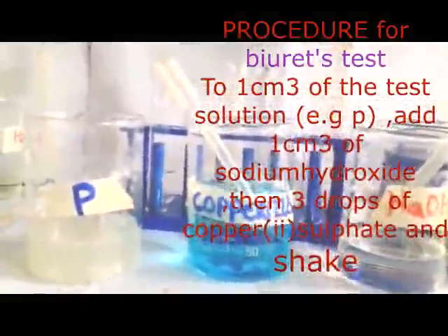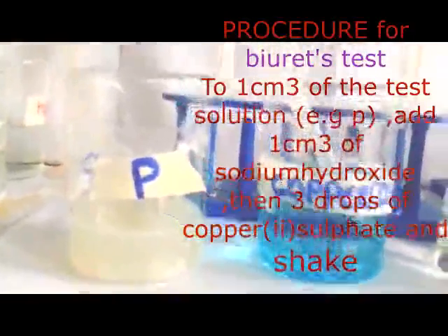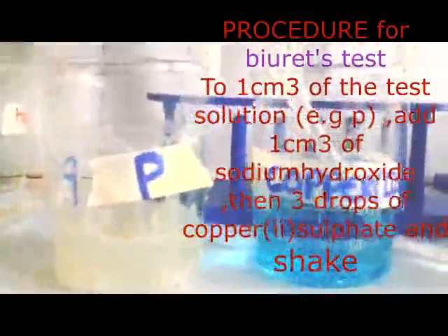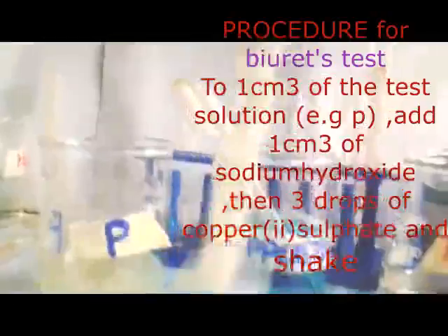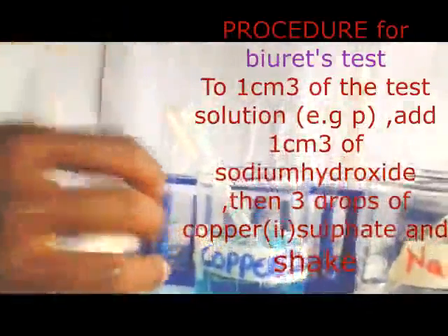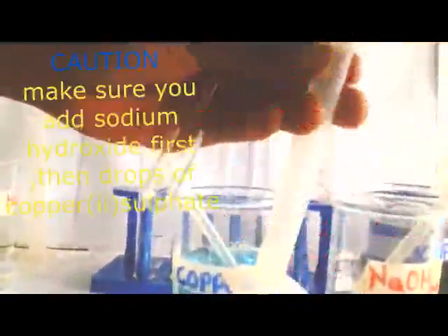What am I going to do here? I'm going to measure 1 cubic centimeter. Always they say here, measure 1 cubic centimeter of solution P. The moment you say measure, then you get your measuring cylinder, then you pour your solution properly. That is my solution now.